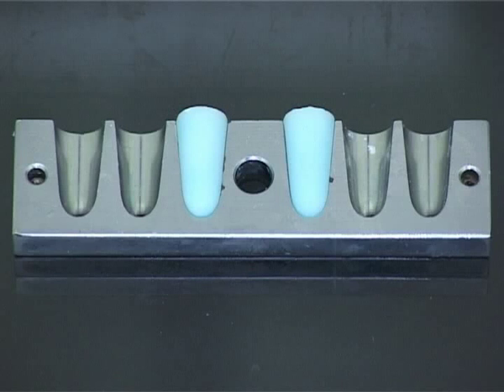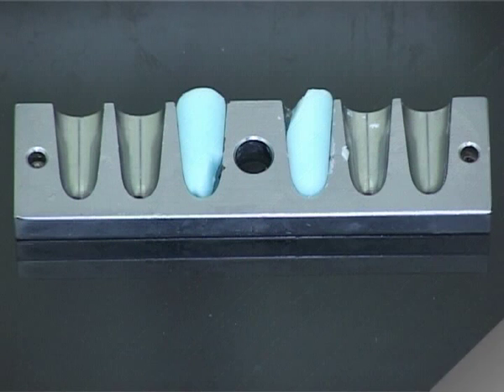Ideally the suppositories should be uniform in shape and colour and have a smooth profile. These suppositories have been damaged either on removal from the mould or in manufacture. They may have been poured when the base was too close to the solidification point.